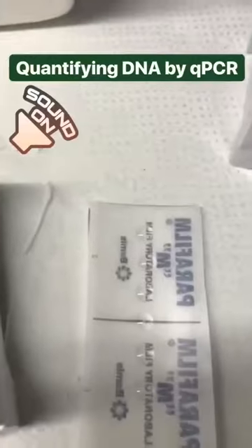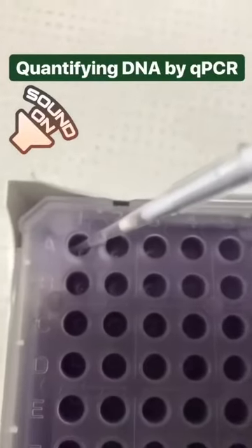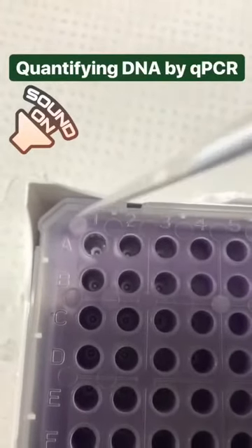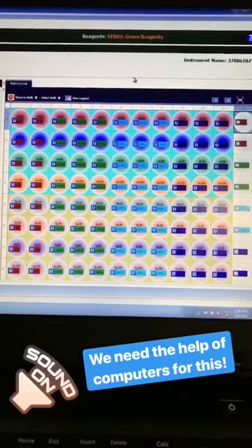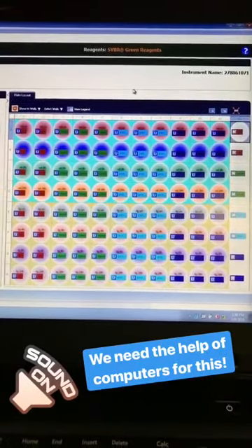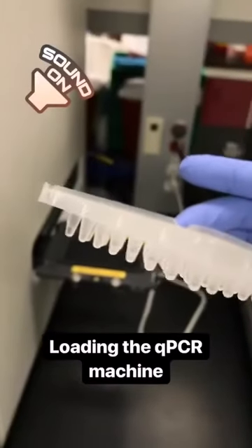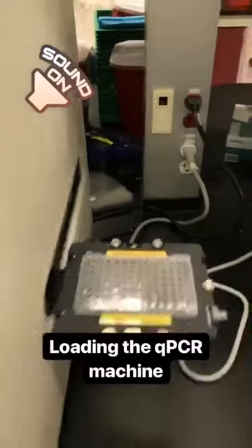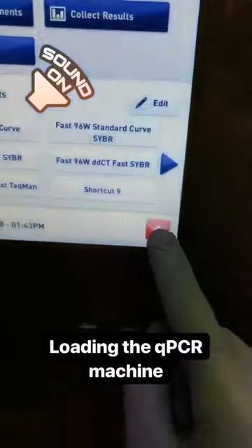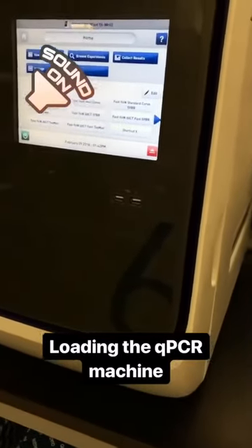To measure the amount of DNA in each of these samples, I'm just going to take them and load them all into this plate. Next, I have to tell the computer which gene I'm looking for in each sample, along with what each sample means, so it knows what I'm trying to detect. Now it doesn't really look like there's anything in here, but I'm going to put the plate into this machine, which is going to cause a bunch of reactions to start. This will allow the machine to measure how much target DNA is in each of my samples.